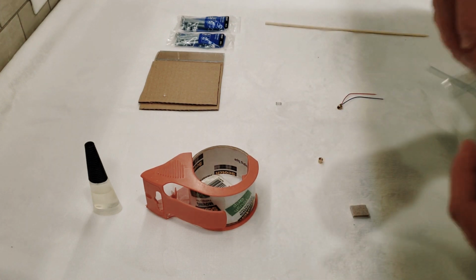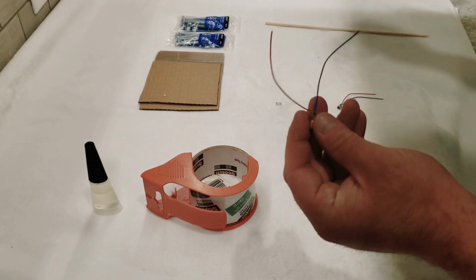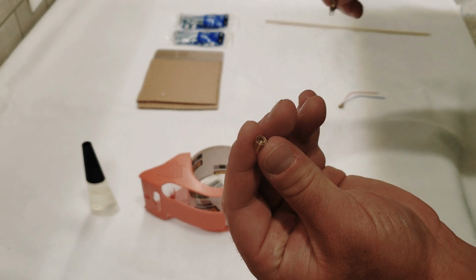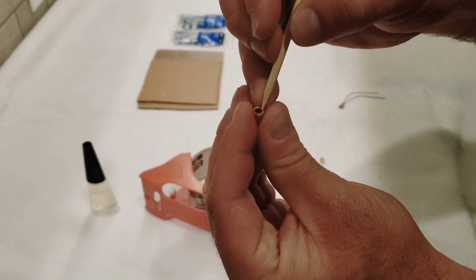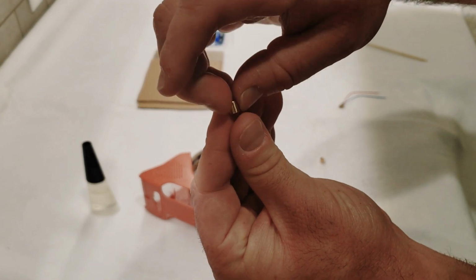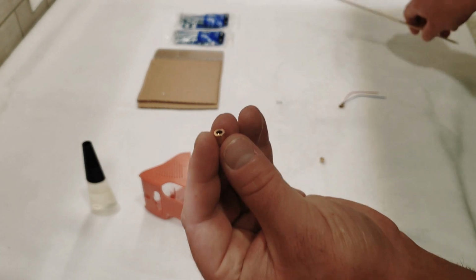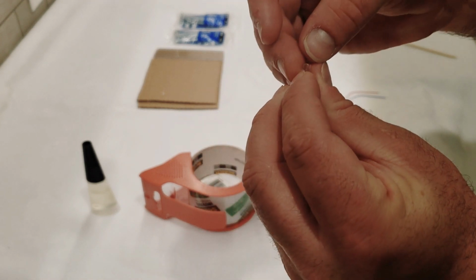And we're just going to grab the second one of these diodes out. Open this one up. You can see this one also has that spring in there, so we're going to set this to the side. And just try to gently, oh, that one came out a lot easier actually. It came almost all the way out. Okay, pluck it just a little bit. And there we go. There is our second lens.